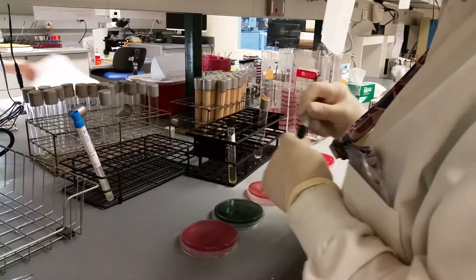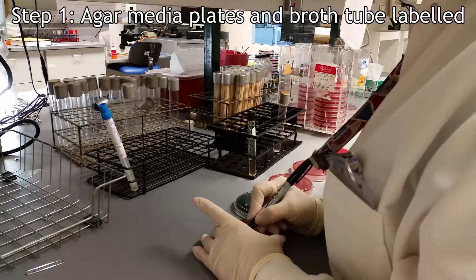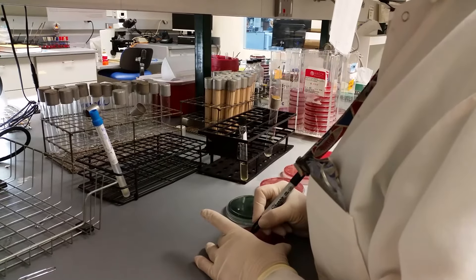The laboratorian first labels each agar medium plate and broth tube with an assigned specimen number and permanent marker.